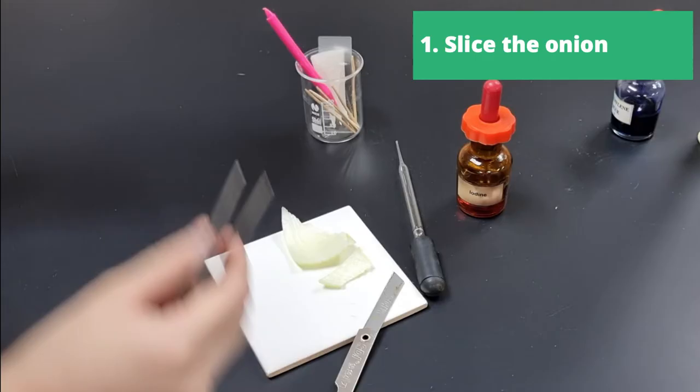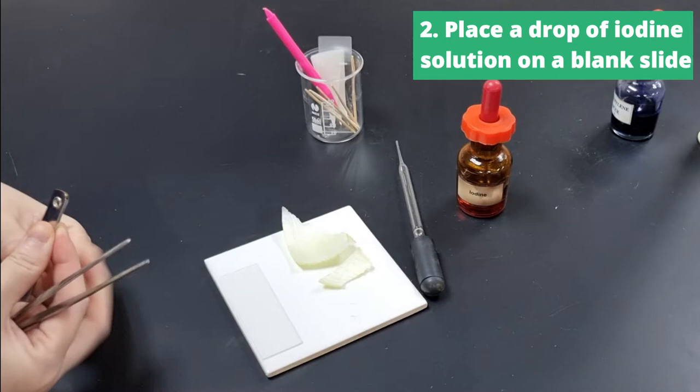Now we just need a small piece to fit on the microscope slide. Next we're going to prep our microscope slide.